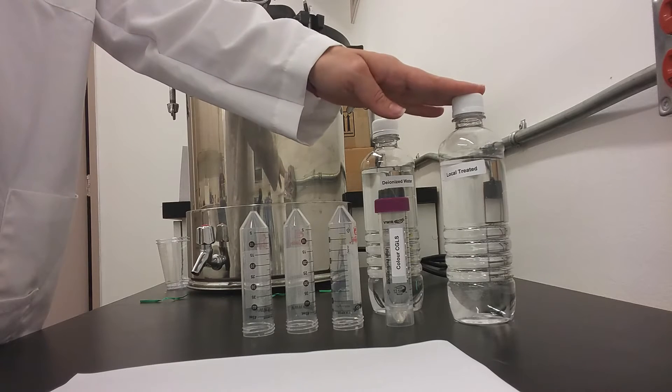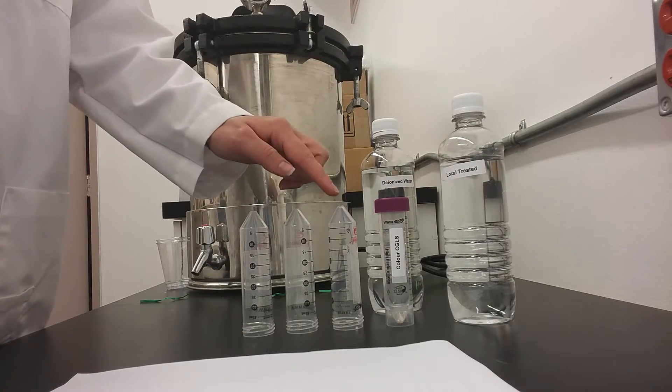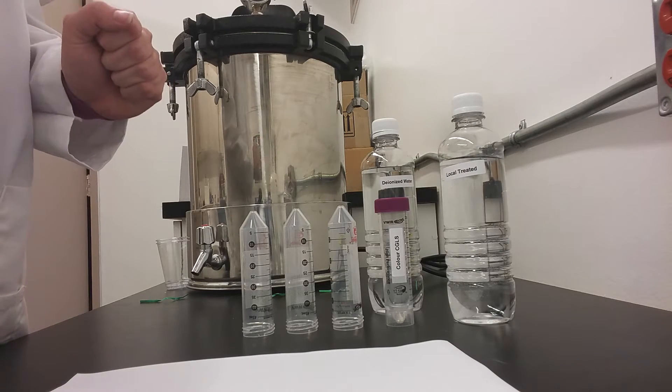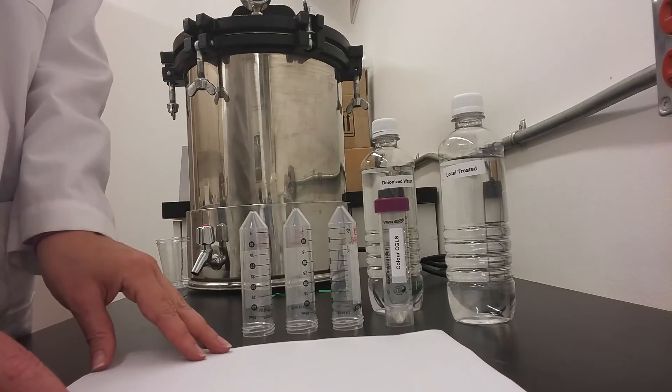For this demonstration we'll be only using the local treated water source, so we only need one extra beaker. For this test you also need a blank piece of paper to hold the water samples above.